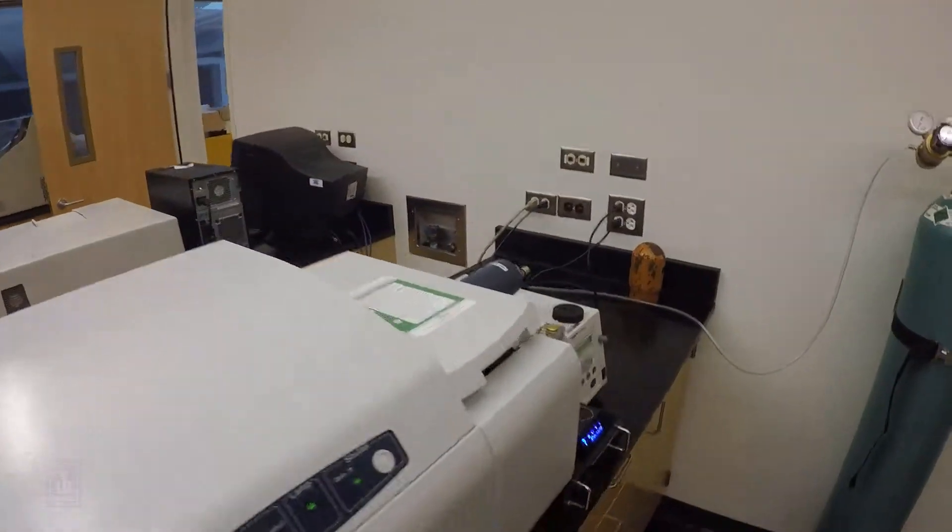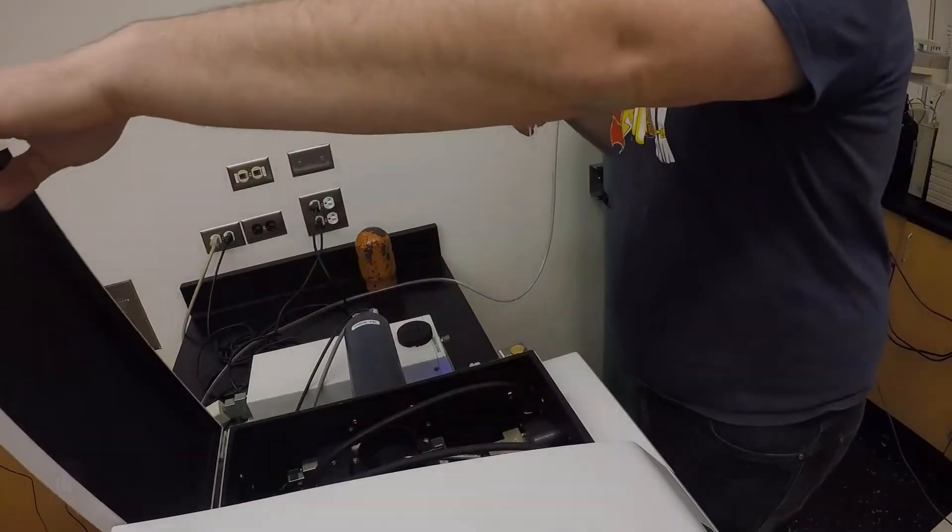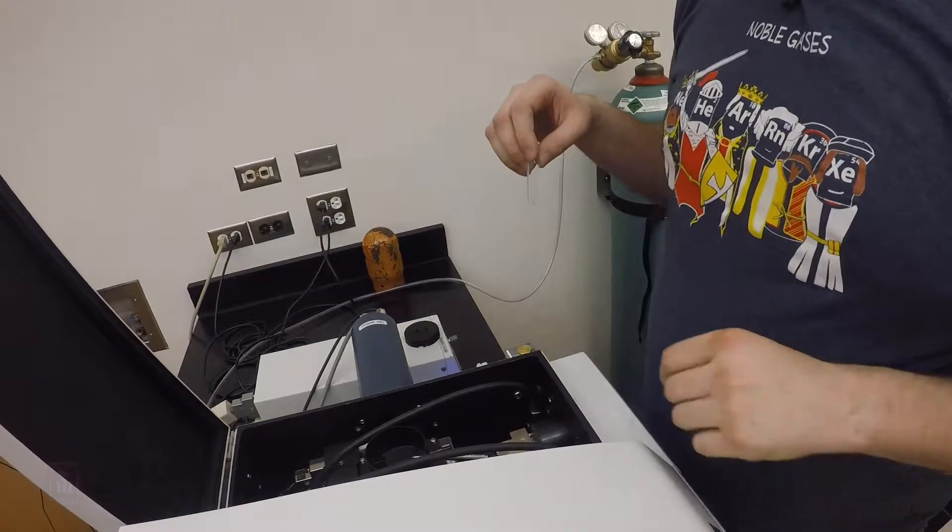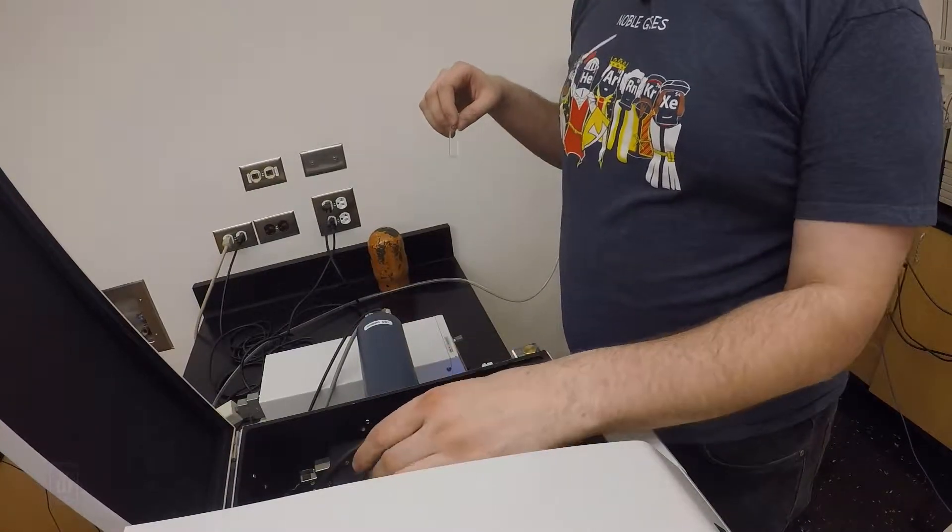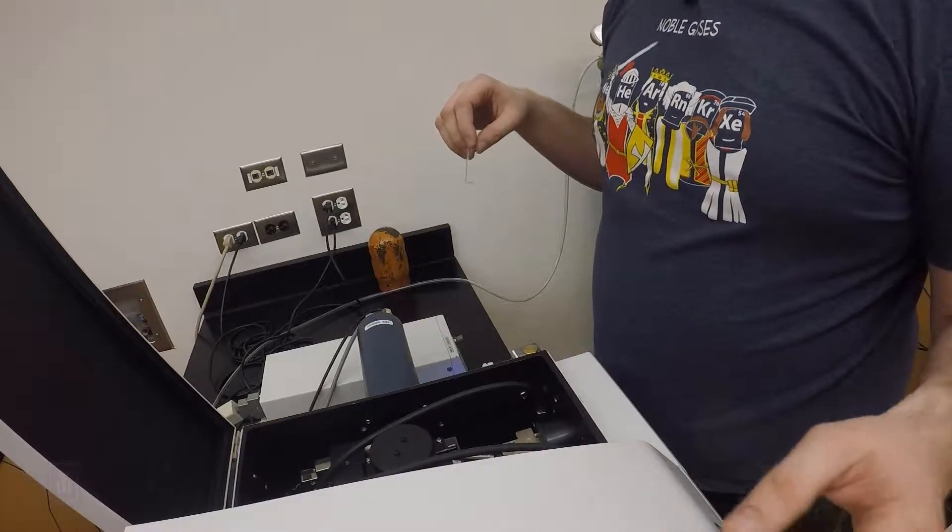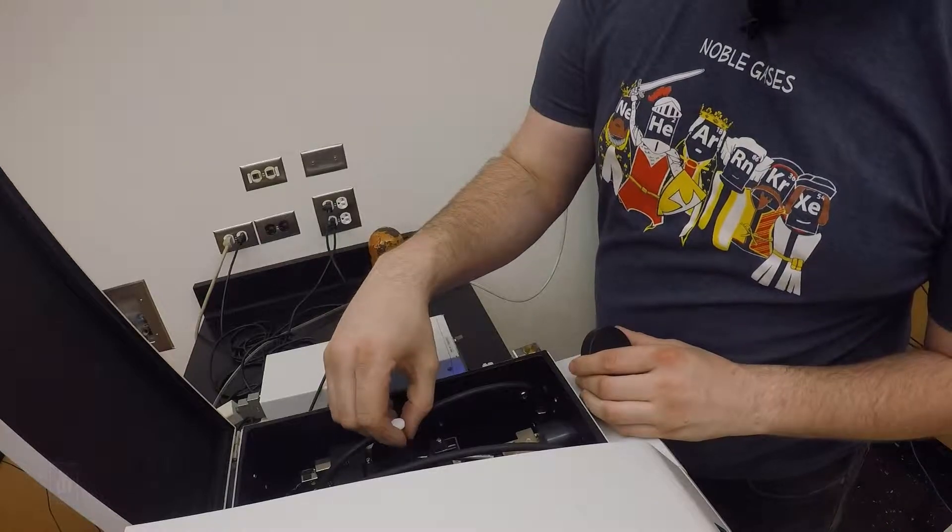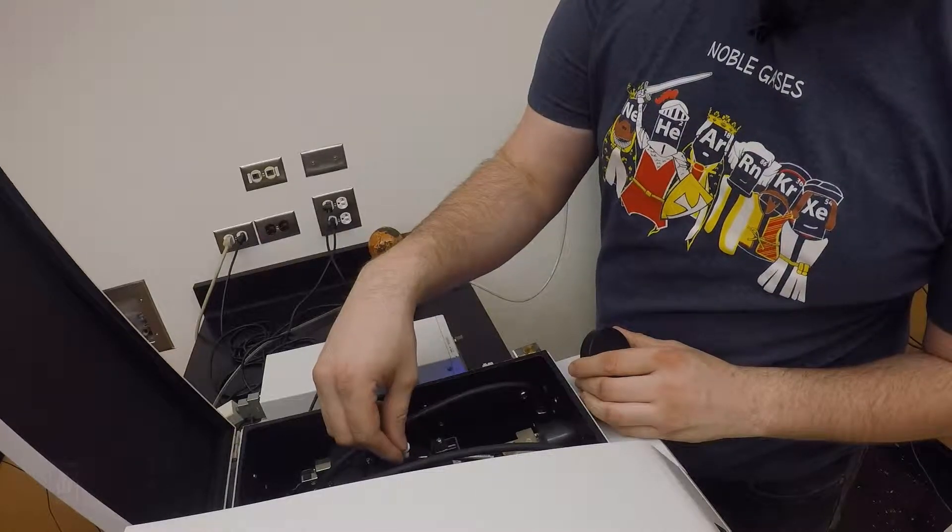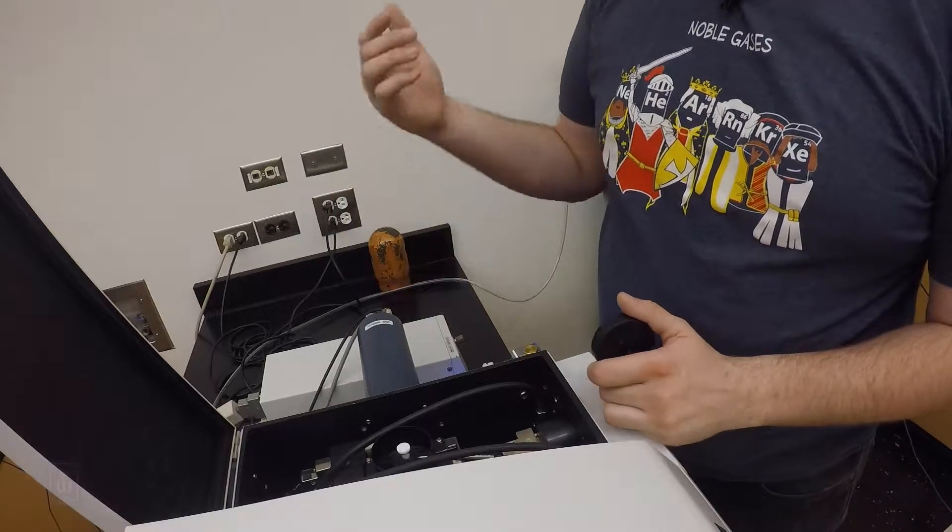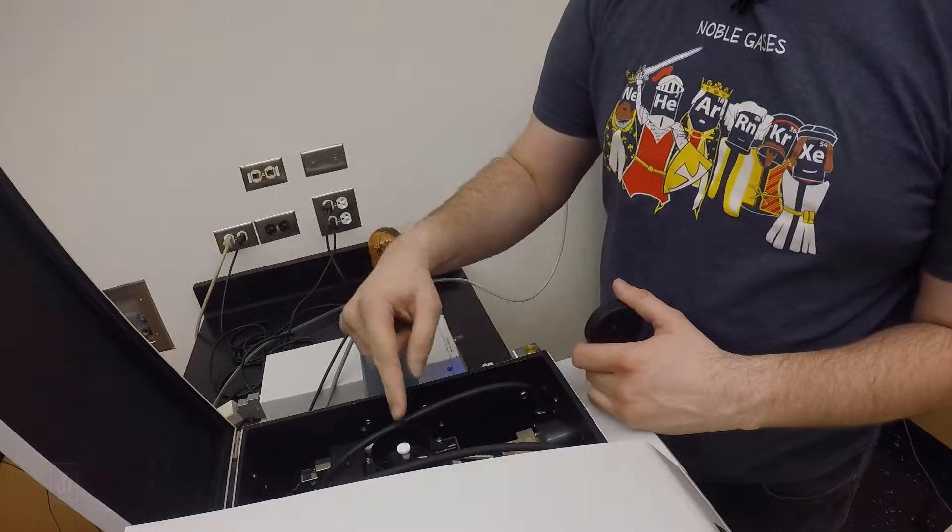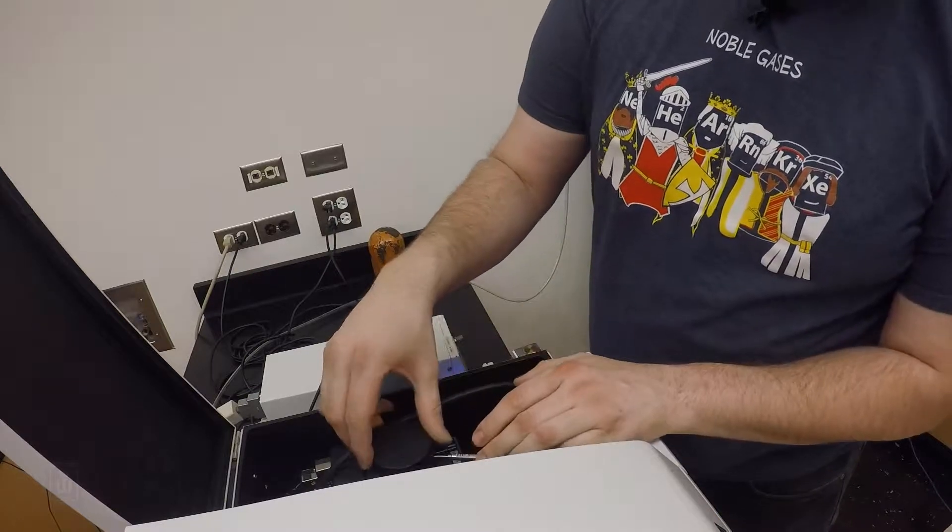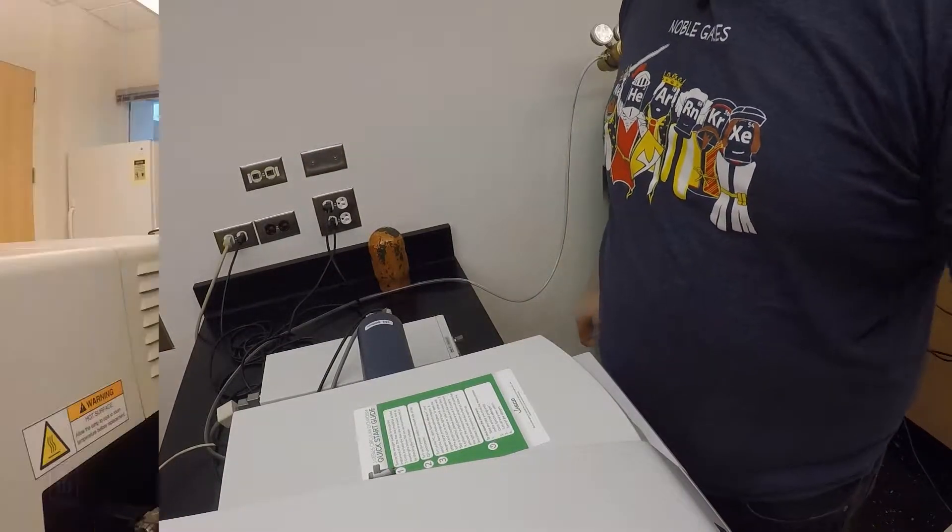On the other side of the instrument, right here is our sample compartment. The sample compartment opens like this and the cuvette holder is actually a little chamber here that is thermally controlled, which we'll see when we do thermal melts and things. But we just need to take the lid off and stick it into the beam. The clear side of the cuvette needs to go into the path of the beam. Here is our detector and our light source that go like this, so we just need to be sure the clear part is there. And then just cover it up.